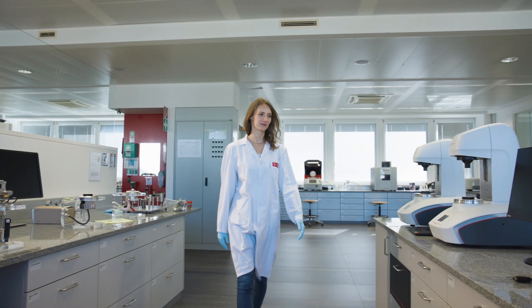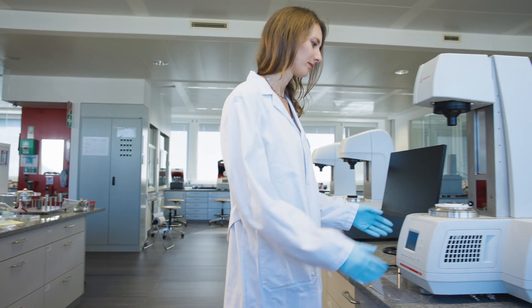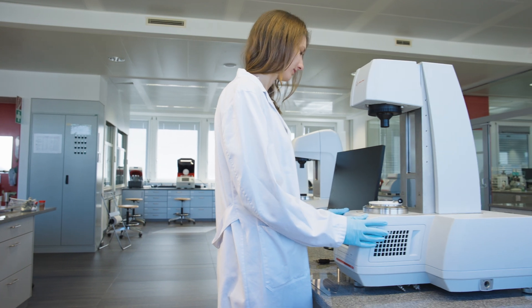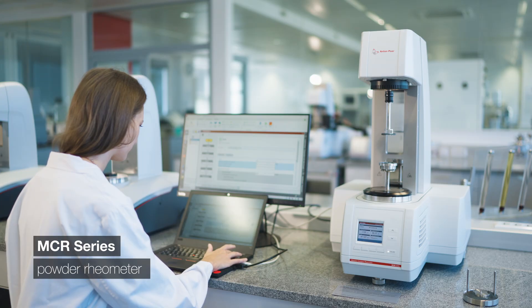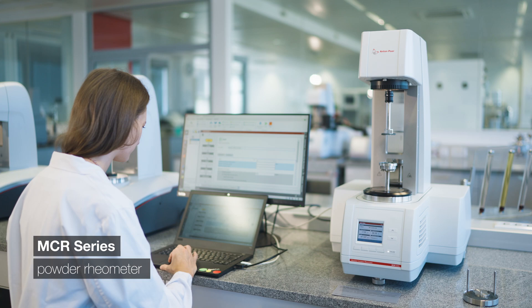For electrode powders, parameters such as compressibility, cohesion, permeability, and angle of friction are important because they predict volume change, packing density, flowability, and storage behavior. All these parameters are measured with a powder rheometer equipped with either a powder shear cell or a powder flow cell.